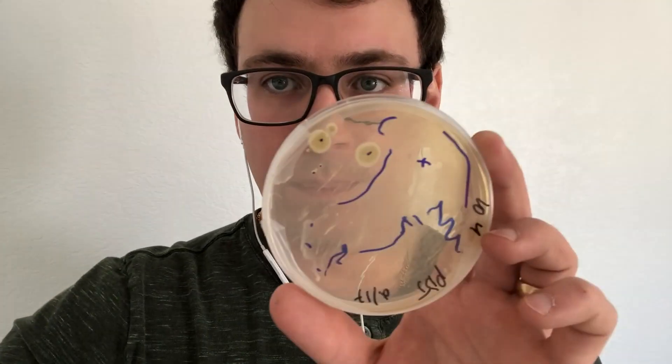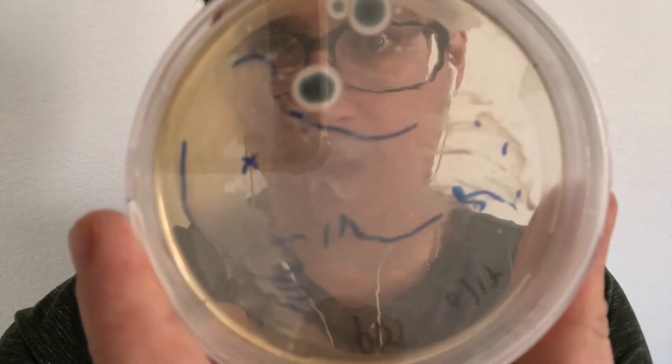I kind of wanted to label all of the isolates and then I'll go through transferring them onto the mini petri dishes. But before then, I wanted to go over some contaminant that I found.